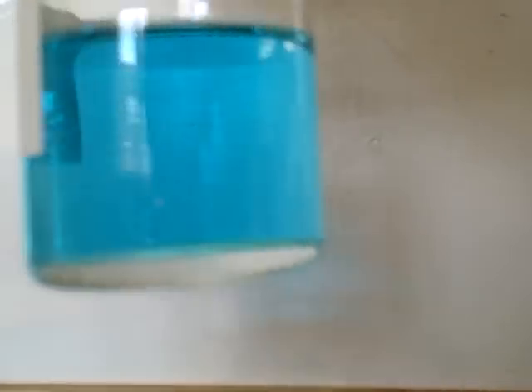One extra thing: there's a difference between clear and colourless. A solution is clear if you can see through it — even a coloured solution like this blue one is still clear because I can see my fingers through the back of it. If it has no colour, it is colourless. So clear means transparent (no solid bits floating in it), and colourless means it has no colour. You'd be expected to know that distinction in an exam. Thank you very much — have a good day.